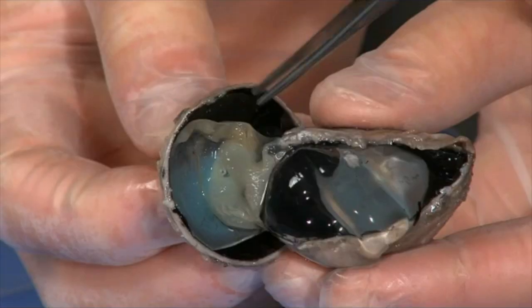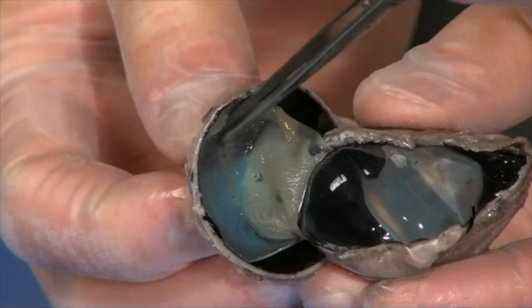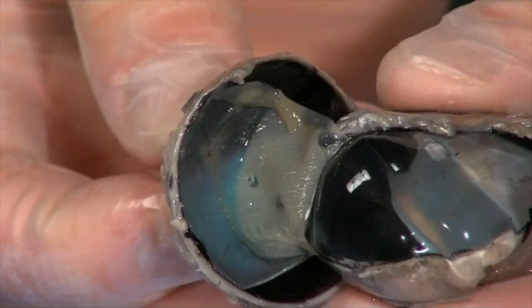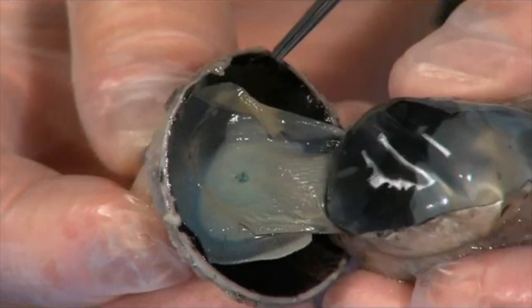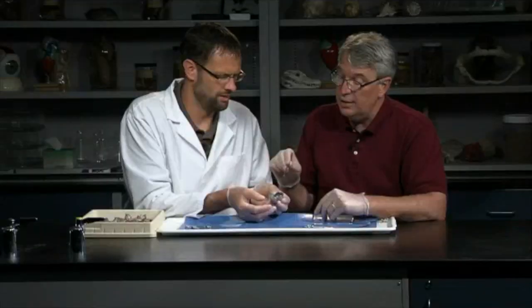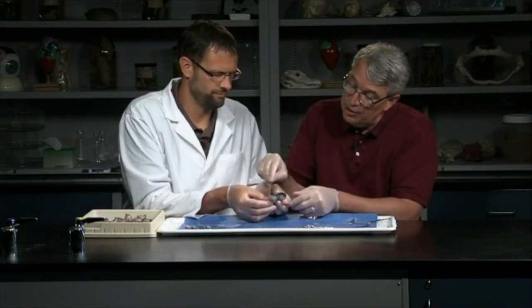And you can see how you might get a detached retina. The retina is not attached in any way to the inside of the eyeball. Instead, it just spreads around it, and the only place it is attached is at the optic nerve. Maybe turn the light right there.